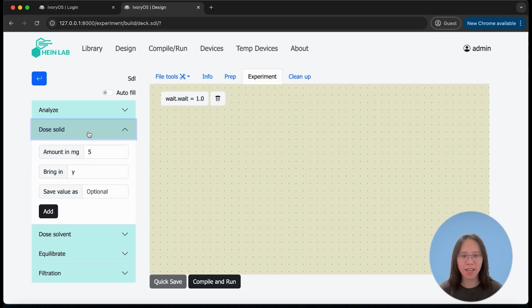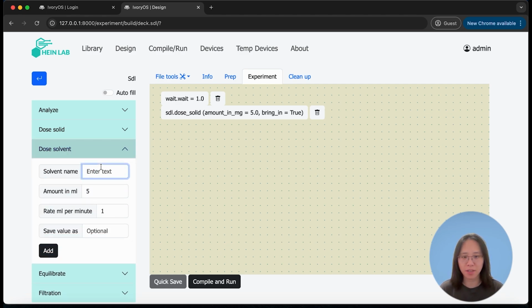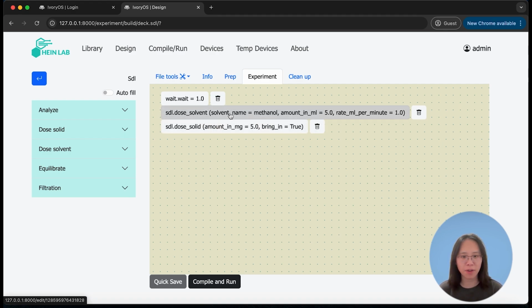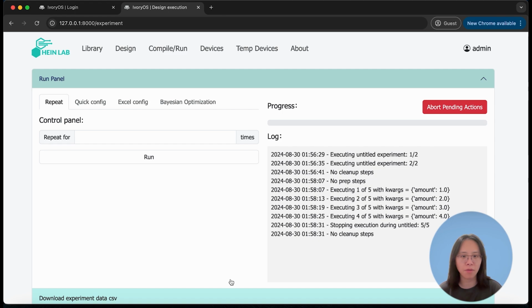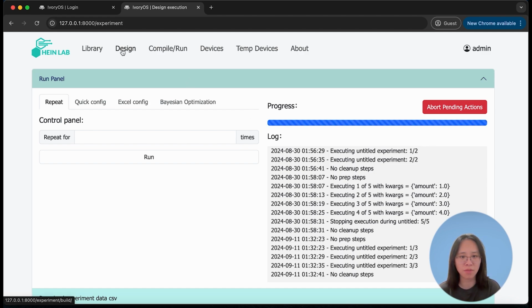Now to complete this design, I will pretend I'm going to dose some solid, and then dose methanol as my solvent. Once I have those actions in my canvas, I can also drag and drop to toggle the action order. And once I'm ready, I can click to compile the script and run. Because in this script all of my parameters are fixed values, the only option I can iterate is by repeating a defined number of times. In this case, I will just run this 3 times. You can see a progress bar showing the current progress and a log panel showing the current iteration steps. And once it's done, it will proceed to the cleanup execution.